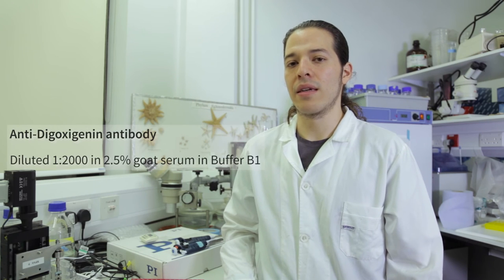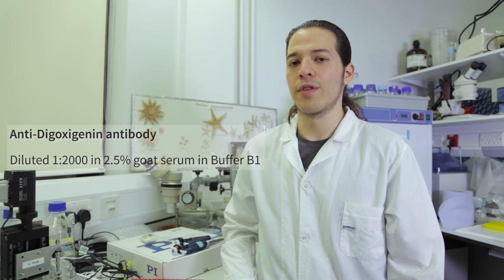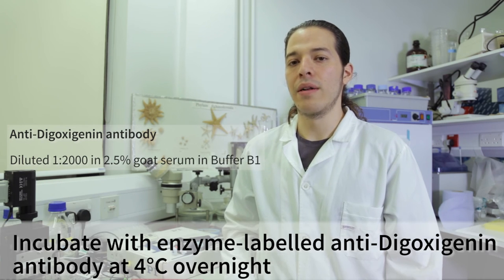Now, I will incubate the slides with anti-digoxigenin antibodies conjugated with alkaline phosphatase. I will leave this reaction overnight in the fridge.